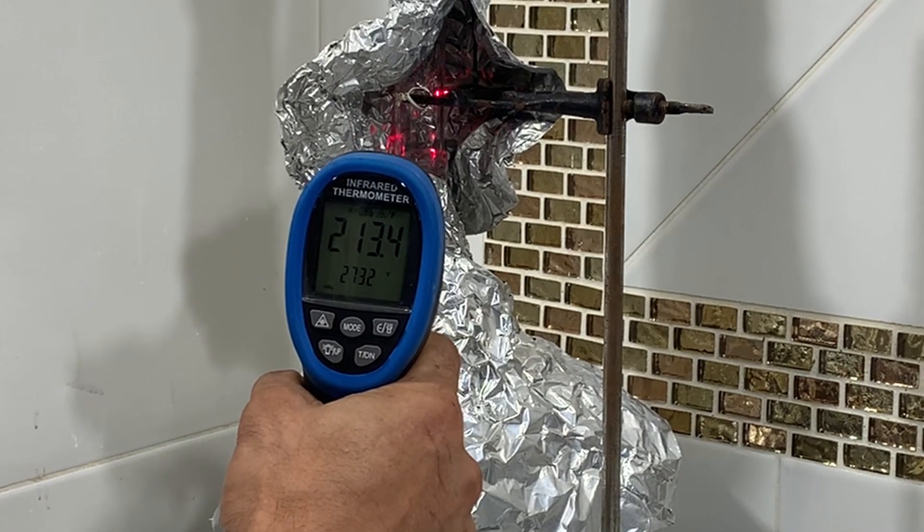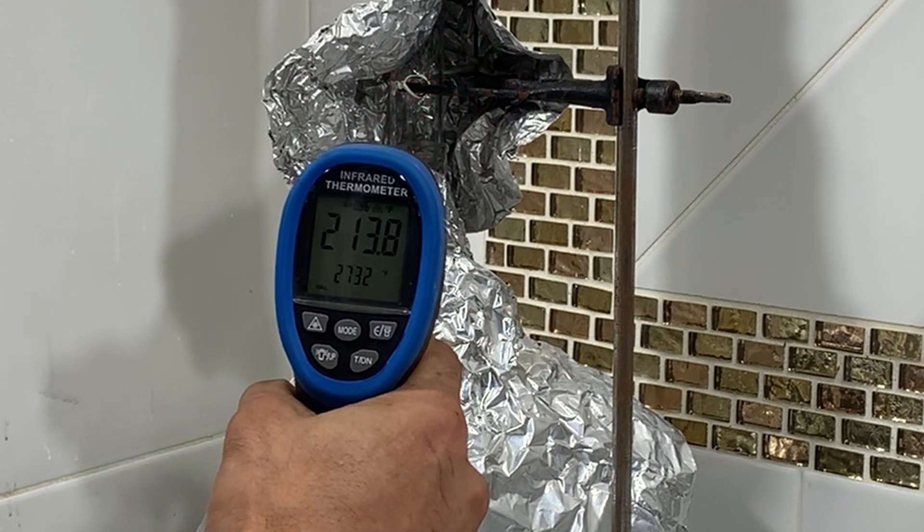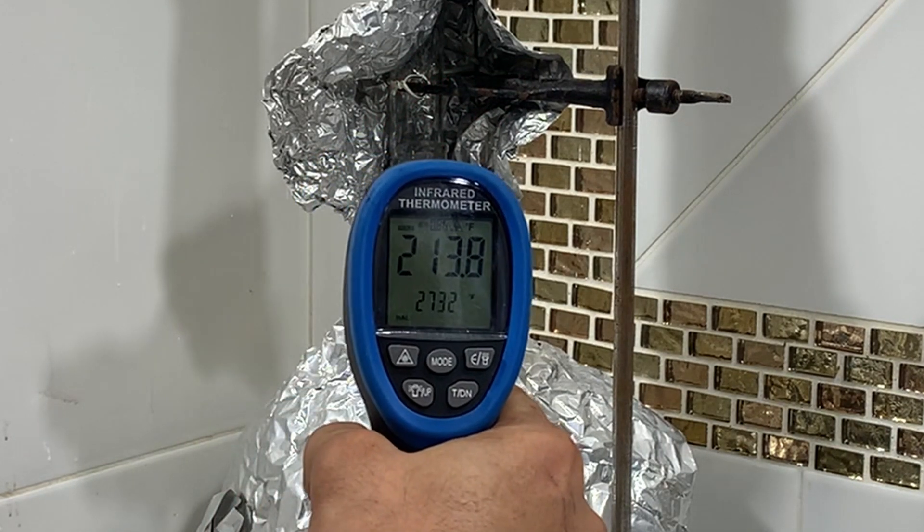I noticed the difference in using one column versus using no columns is that you gain a little bit of control over temperature.